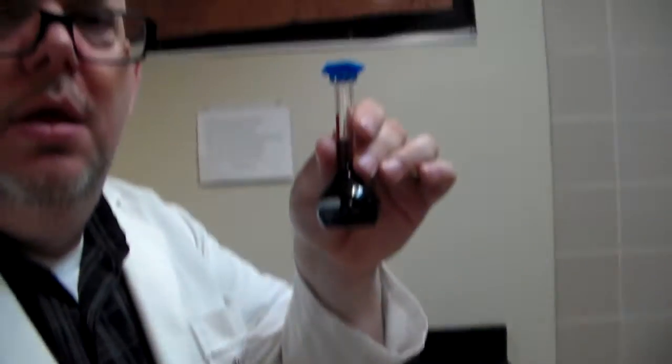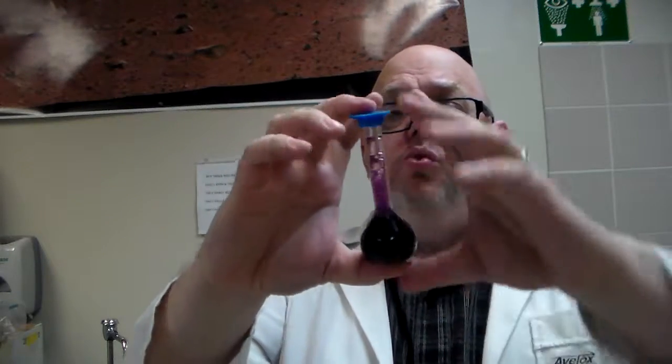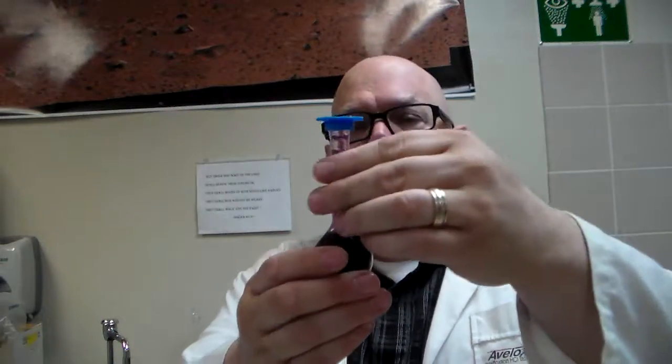All right. Now that you have it done, you can start inverting it. The reason you're inverting it is you want to make absolutely sure that you're spreading out the food dye throughout the entire distilled water. Remember, you're diluting the concentration. I'm going to give you guys the stock solution. I'm going to have to water it down from the original because we need to get some kind of reading, and then we're going to start from there. Even though I've mixed it up, it's okay if you have all these air bubbles in there. That's fine. We just want to dilute it.